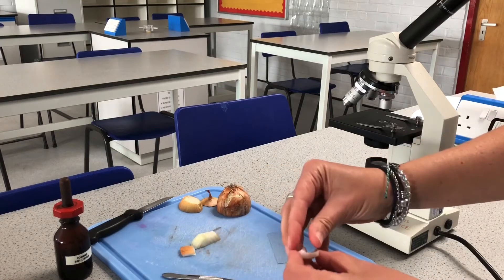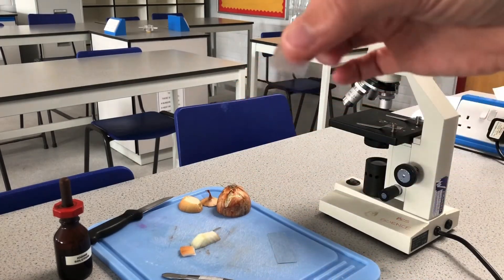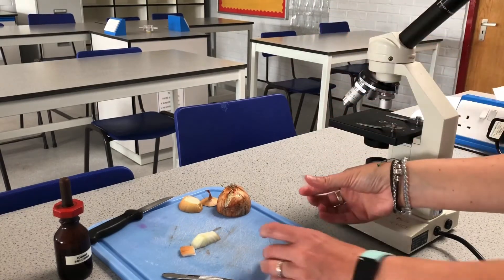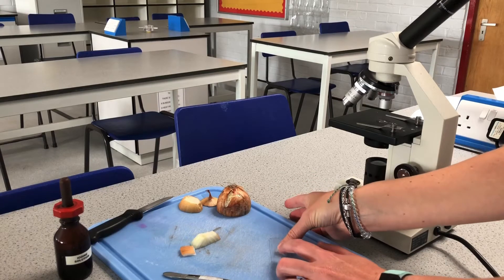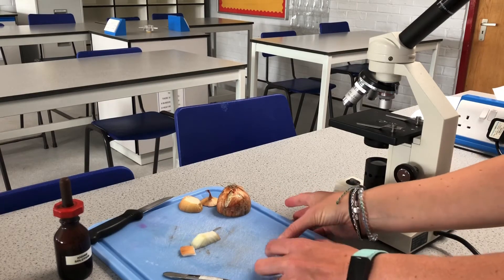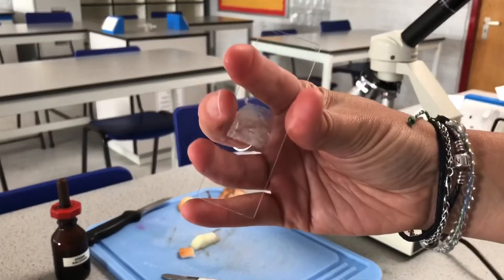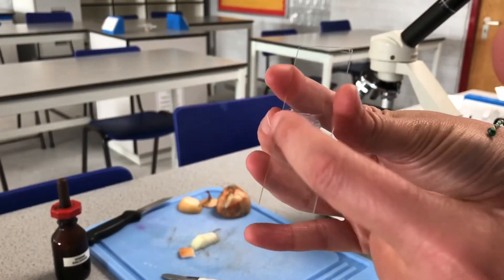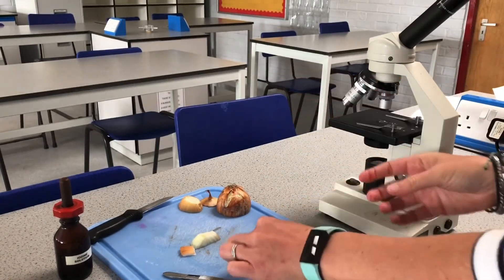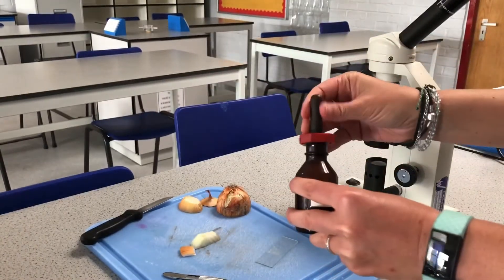If I rip it I can always just get another piece — no big deal. I've peeled it back and I'll use my fingers to handle this piece of onion skin. I'm going to pop it onto the slide — it doesn't matter which way around — and I want it to be as flat as possible, not runkled up.